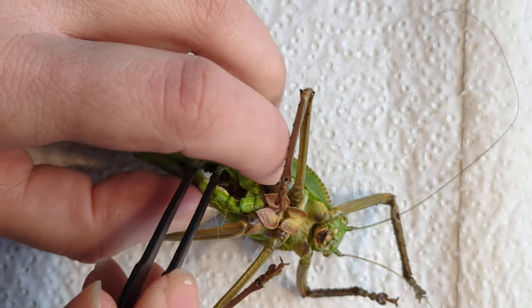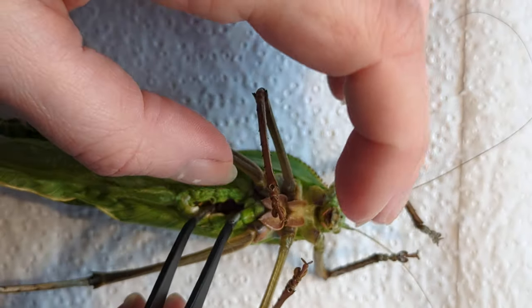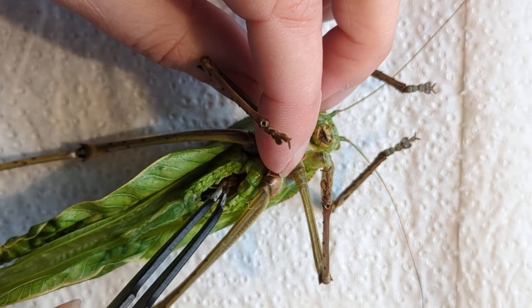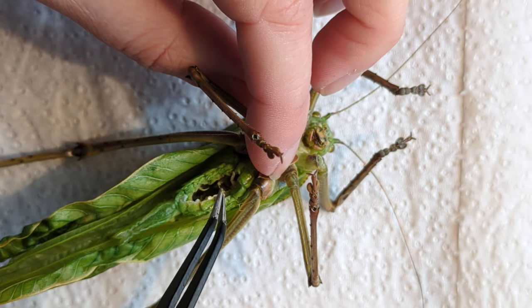I just put them in a container wrapped in a piece of tissue, a piece of kitchen roll. That will help keep them from getting too frostbitten, but they will otherwise just stay indefinitely in the freezer until you are ready to preserve them.